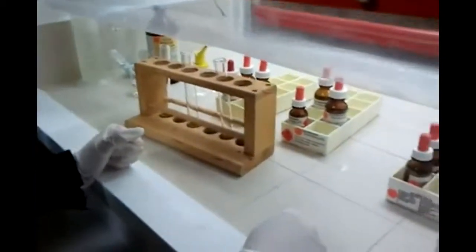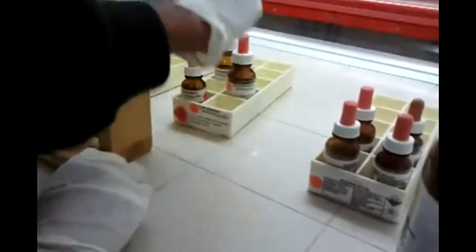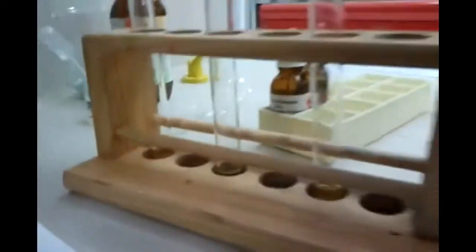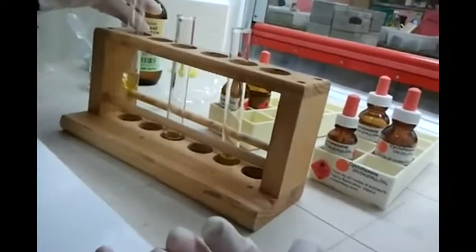So the first test tube, add something of cyclohexane. Cyclohexane — that's hexane. Okay, we do one. Let's do cyclohexane. Get ready for the observations. You can watch the video again. So it's yellow. You're excited so they can see it. It's yellow. Just add it all in. It's separated. You can see how it's separated. But that's not correct — if the layers are separated that means it's hexane. It's hexane. Yeah, it shouldn't react. Exactly. So there should be two separate layers.